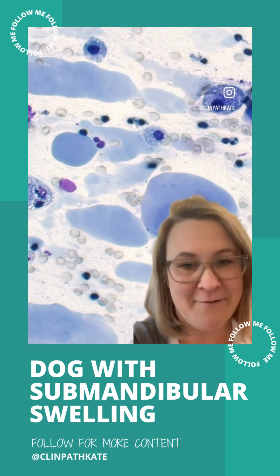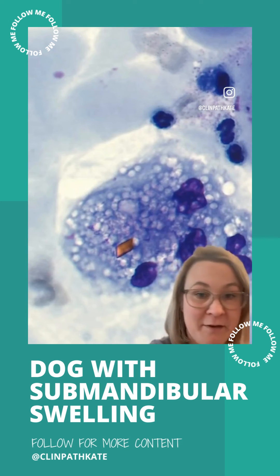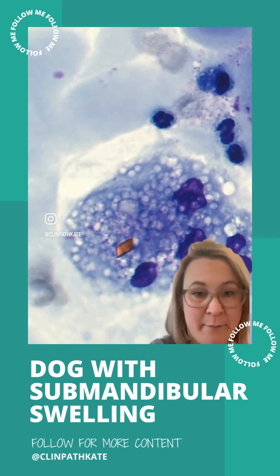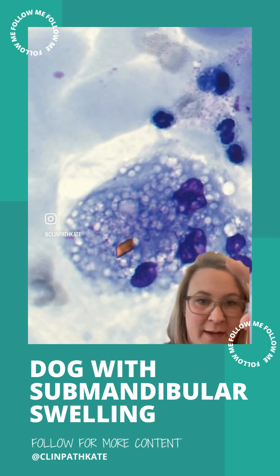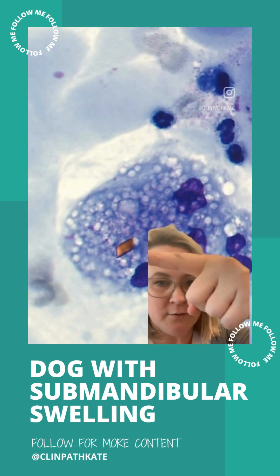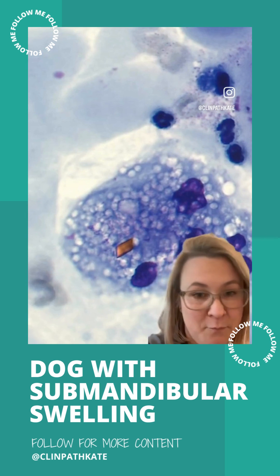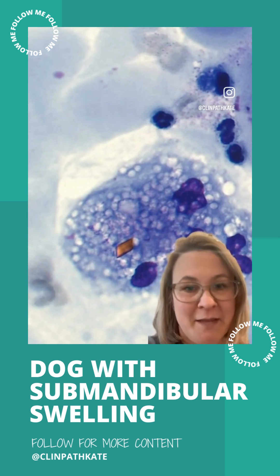Inflammatory cells are very common. It's also quite common for these salivary mucoceles to have some internal hemorrhaging. Here in this multinucleated macrophage, you can see this little rhomboid orange crystal, which is a hematoidin crystal — a red blood cell breakdown product — consistent with hemorrhage.